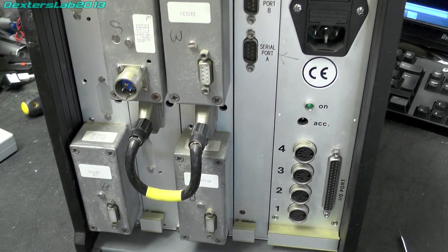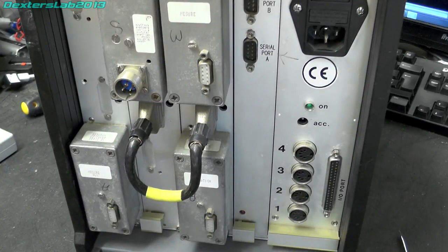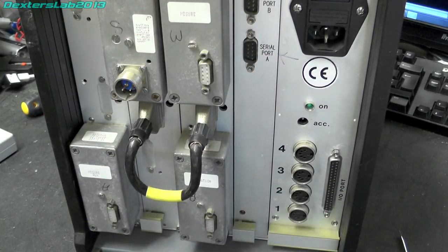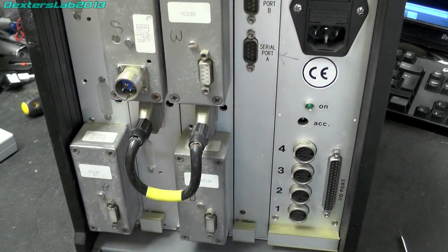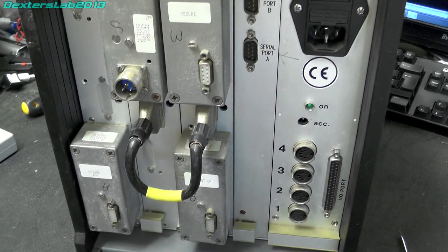Right, I've just had this connected up to a serial port. I've tried both port A and B, various baud rates, bits, stop bits, all that sort of stuff. Can't really get anything out of it. Absolutely nothing on B. Got a few oddball characters out of serial port A, but nothing certainly readable or ASCII. So I wonder whether the interface between this and the PC, presumably this connects to the PC, is possibly a purely binary thing, and you're not really expected to have any readable text over it anyway.